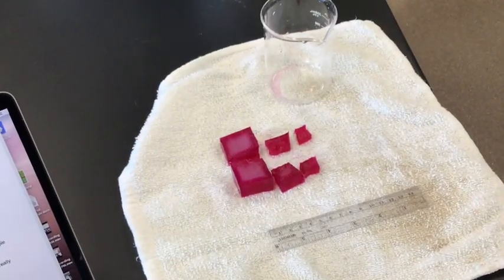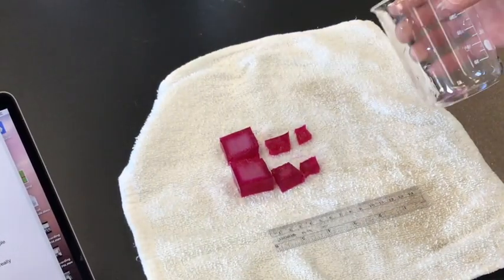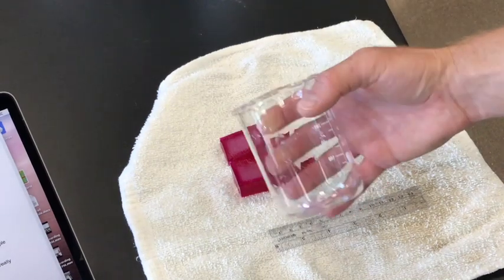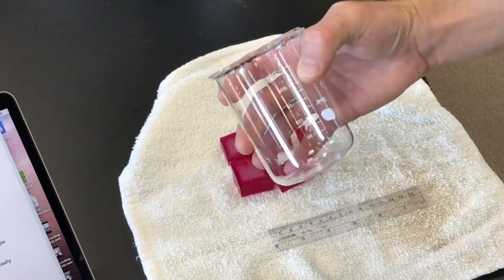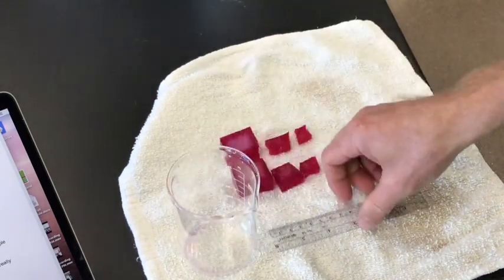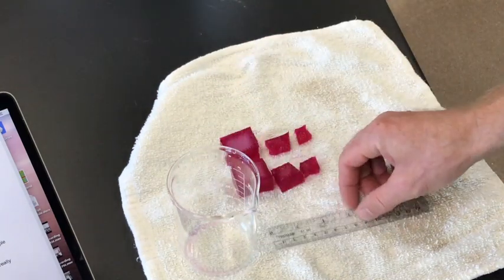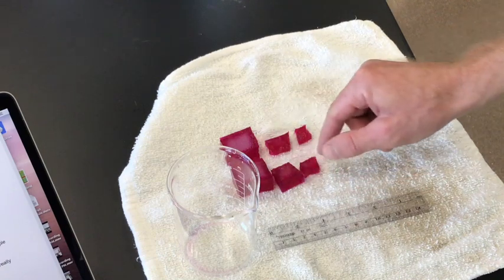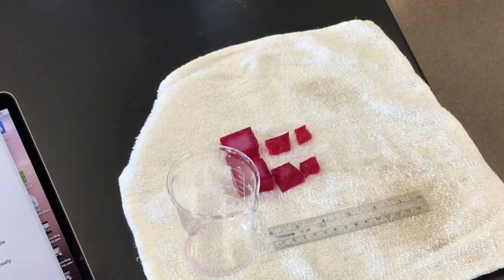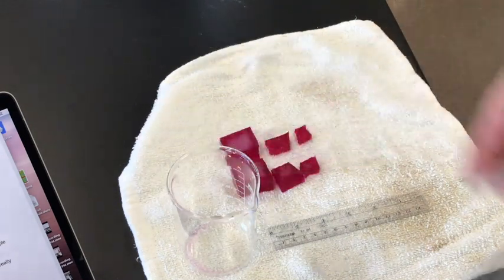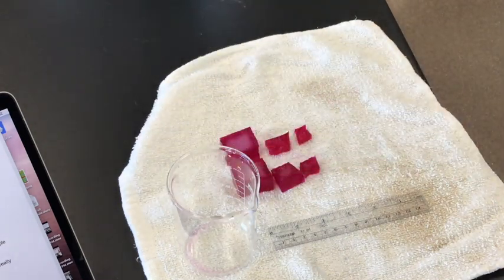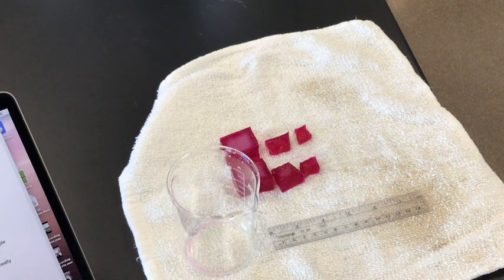So finish the write-up and submit it to Schoology. It's the cell size cube lab, kind of a fun lab to do first. Well, first day for us in 2020 of school. Now this needs to be better cleaned, right? So I mean it looks like I still see a little liquid in there. I'm going to rinse that off a little better. It doesn't have to be dry, it has to be rinsed really well, set aside. Same with the ruler - rinse really well, set aside. Cubes can go in the garbage, and then we'll spray our tables and wipe our tables off. Then goggles go back in the goggle cabinet and we'll use the UV light in between classes to sterilize those. All right, hope that was helpful, and have a great day.